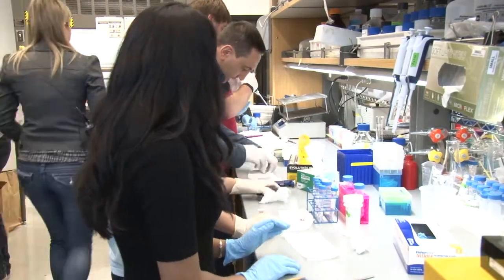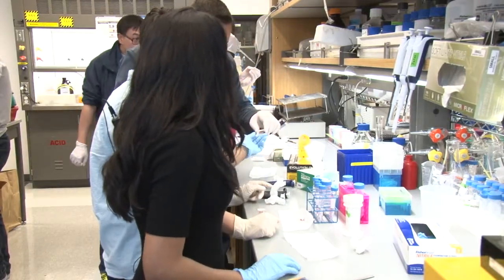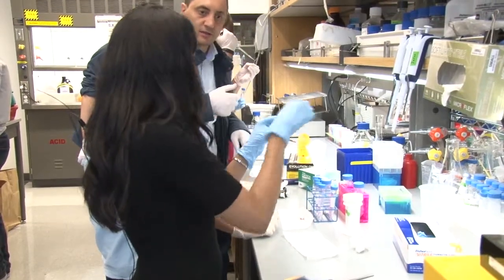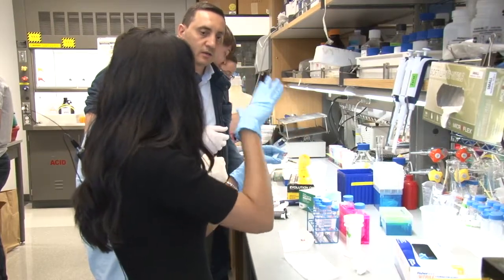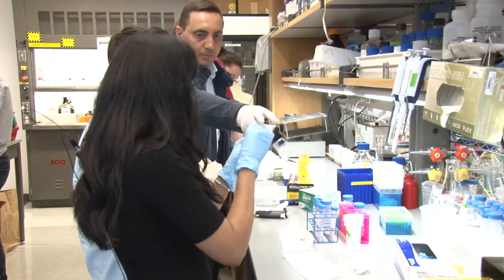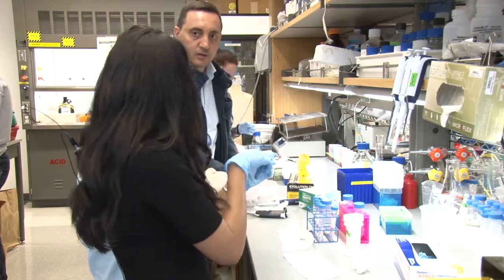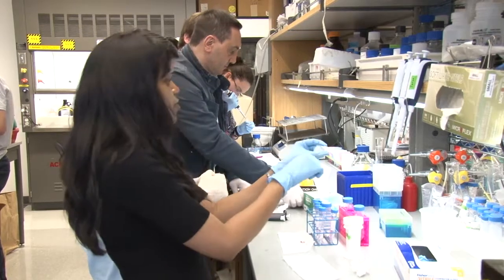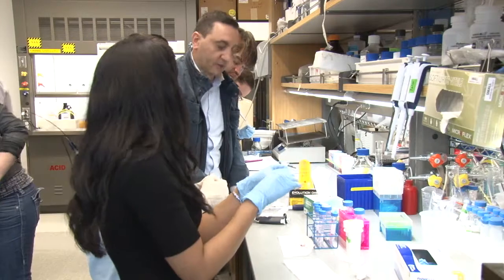Some came out from the side — maybe it was not well attached. If your seal chamber is not stuck well, you might see liquid leaking out. This could be because either it didn't adhere properly or there was moisture there already, so the adhesive didn't work. But over time your reagents would start leaking. If you had a different tissue section with a different probe, you don't want to mix them.